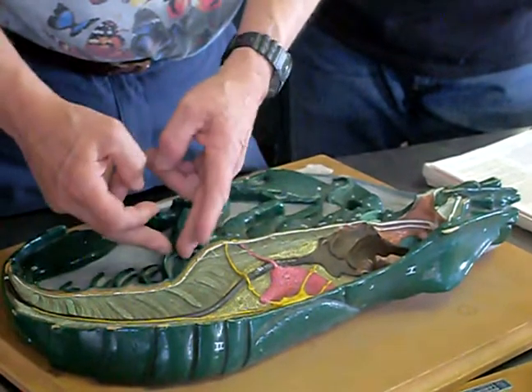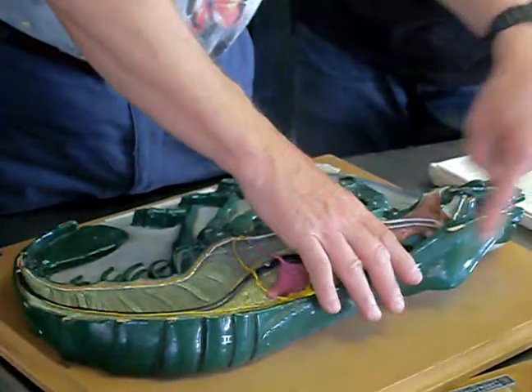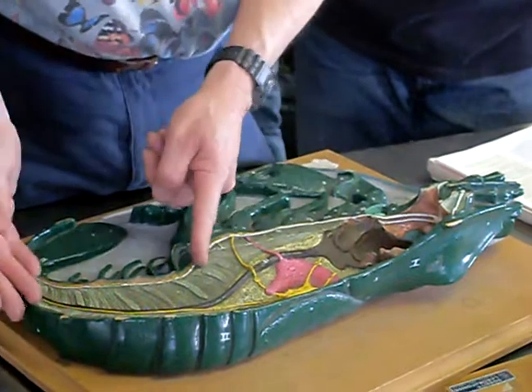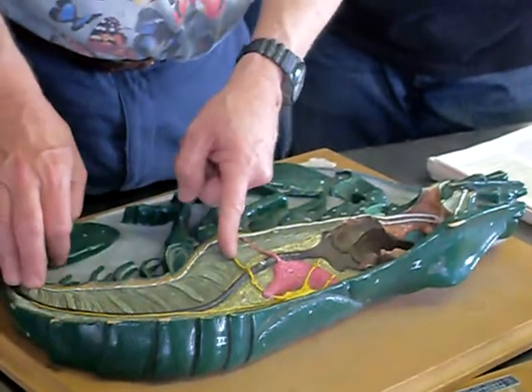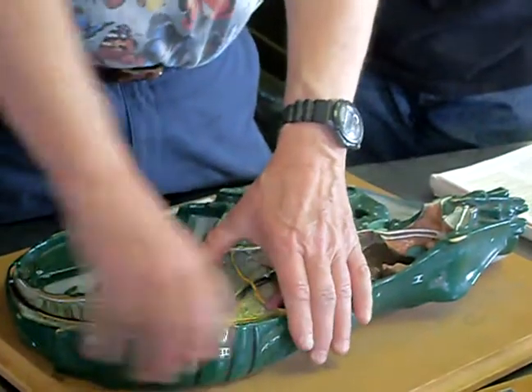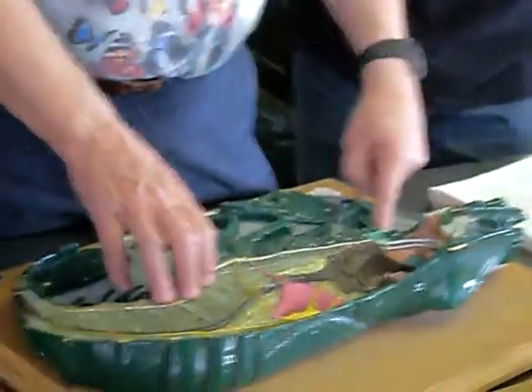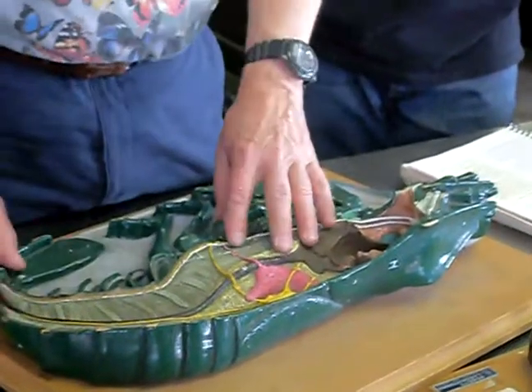So we have the head, then the thorax, which has all the legs and is specialized for locomotion. Then we have the abdomen, which is filled with muscle tissue. This is the part we like to eat. If this were a shrimp, the only part we would eat — we'd break off the tail — would be this part. If it was a lobster, we would eat this part, but there's also a big chunk of meat in the claws. But basically, this is the part we like to eat: the abdomen.